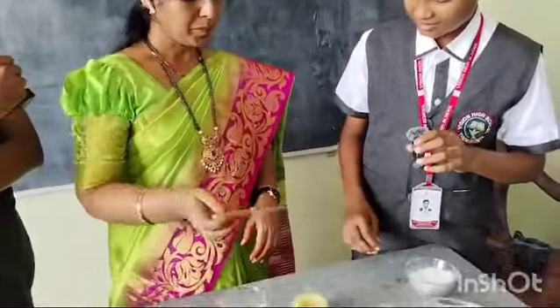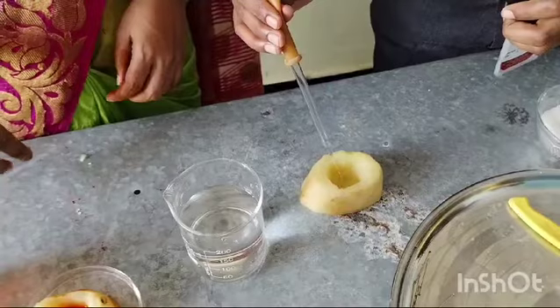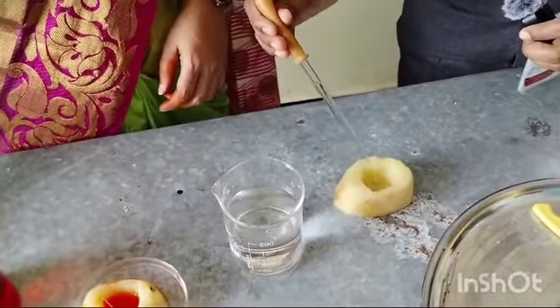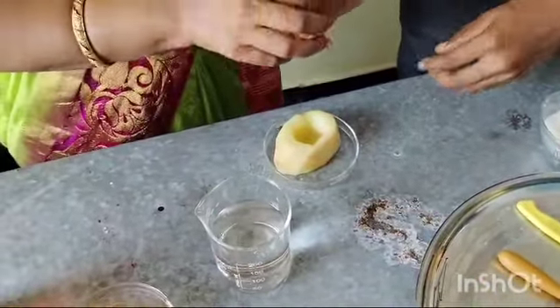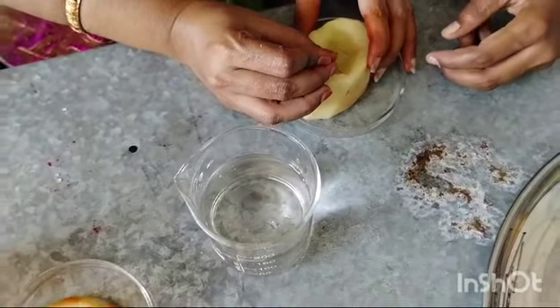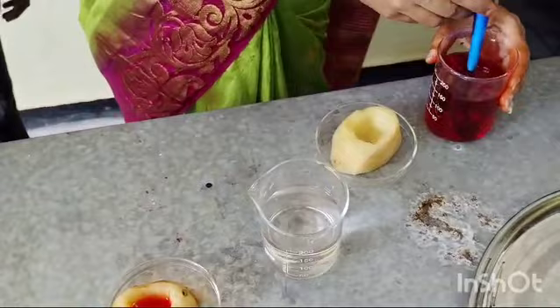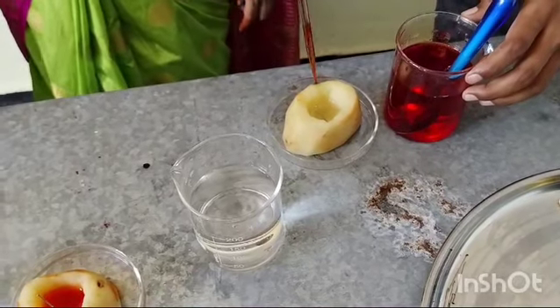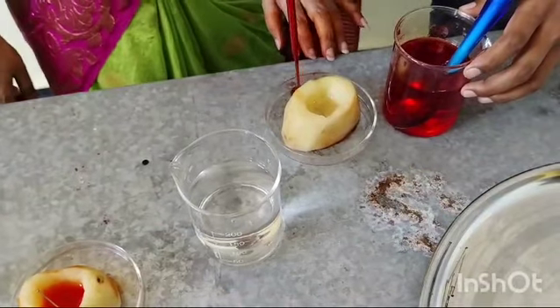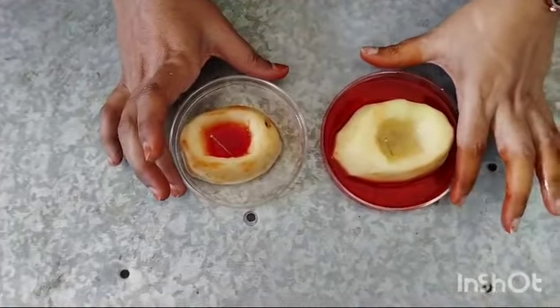Now Nihal, pour water into the potato cup up to half, and mark the level with a ball pin. For the second petri dish, mark with a ball pin and pour some sugar solution. Leave these two potato cups for a while.